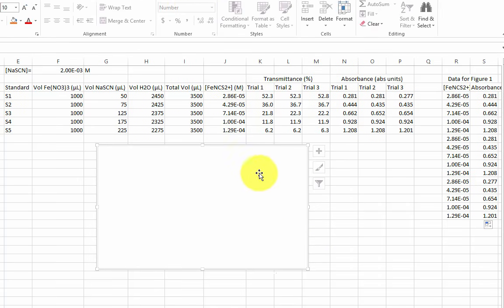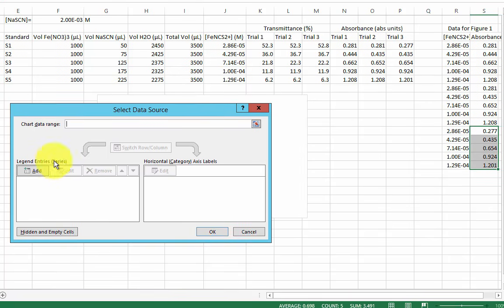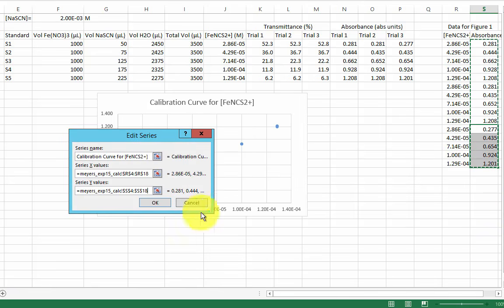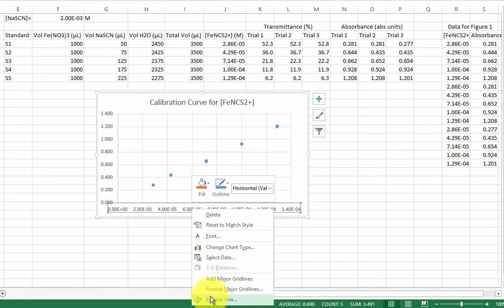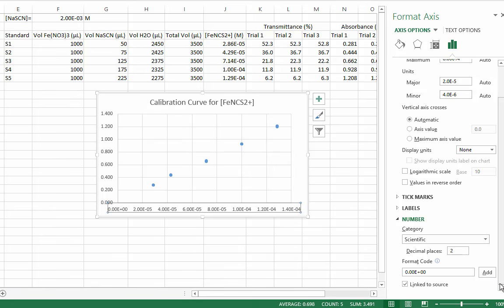This data is ready to add to the scatter plot. Again, click Select Data and add a series. Our title will be Calibration Curve for Iron Thiocyanate. The X values are concentration and the Y values are absorbance. It looks like the axes sig figs are correct. If you needed to change them, click on the axis labels, right-click, select Format Axis, and expand the Number section. You can change the values to or from scientific notation and also determine the number of decimals.